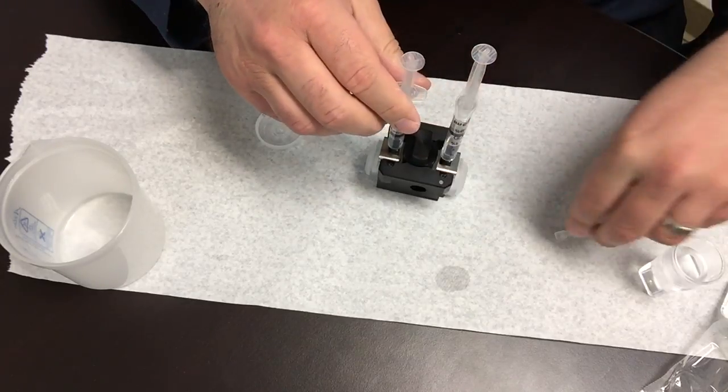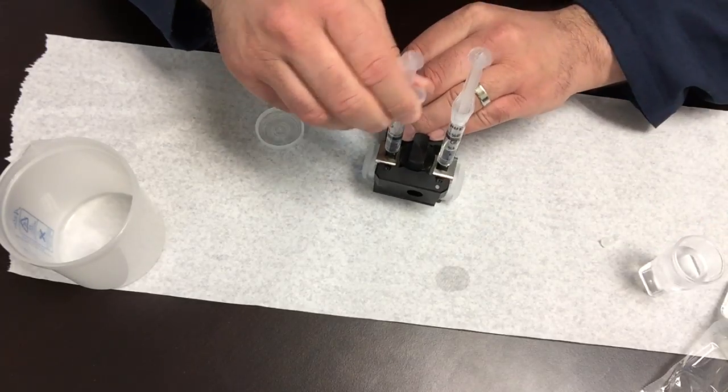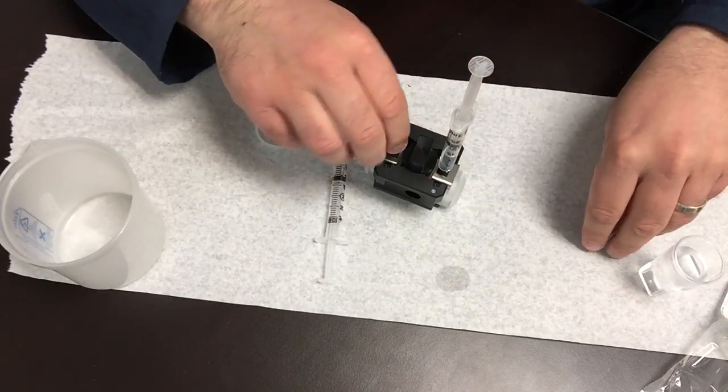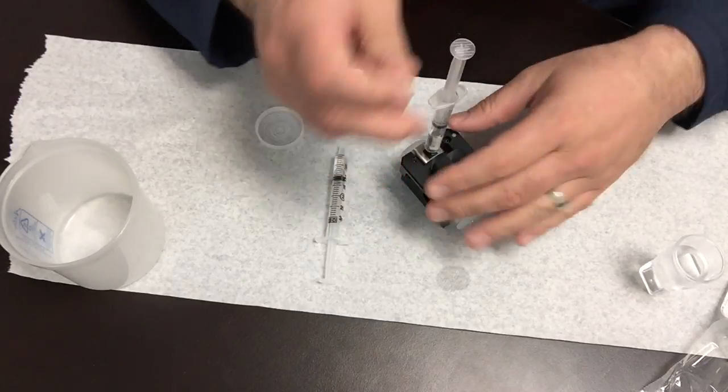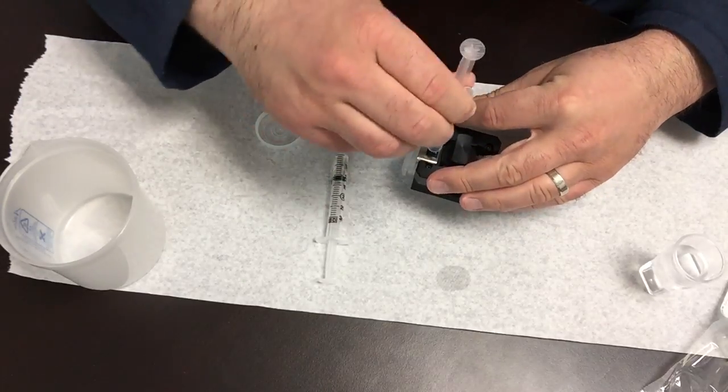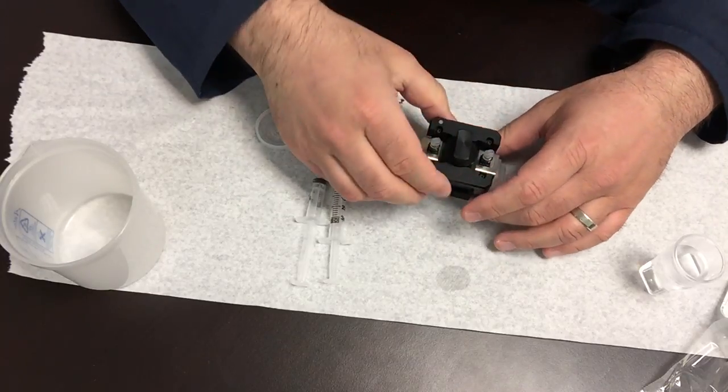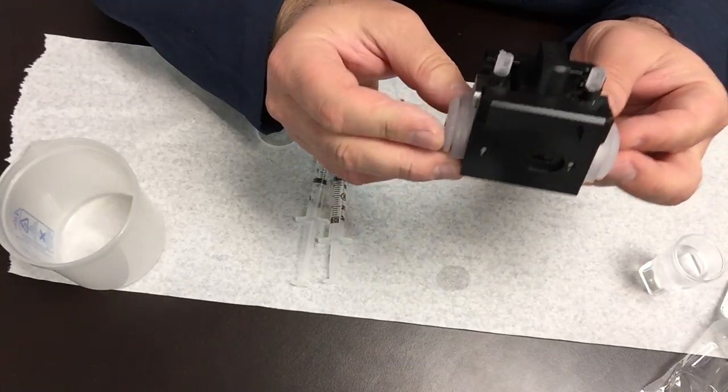Plug it in, the same thing on the other side, now you're ready for analysis.